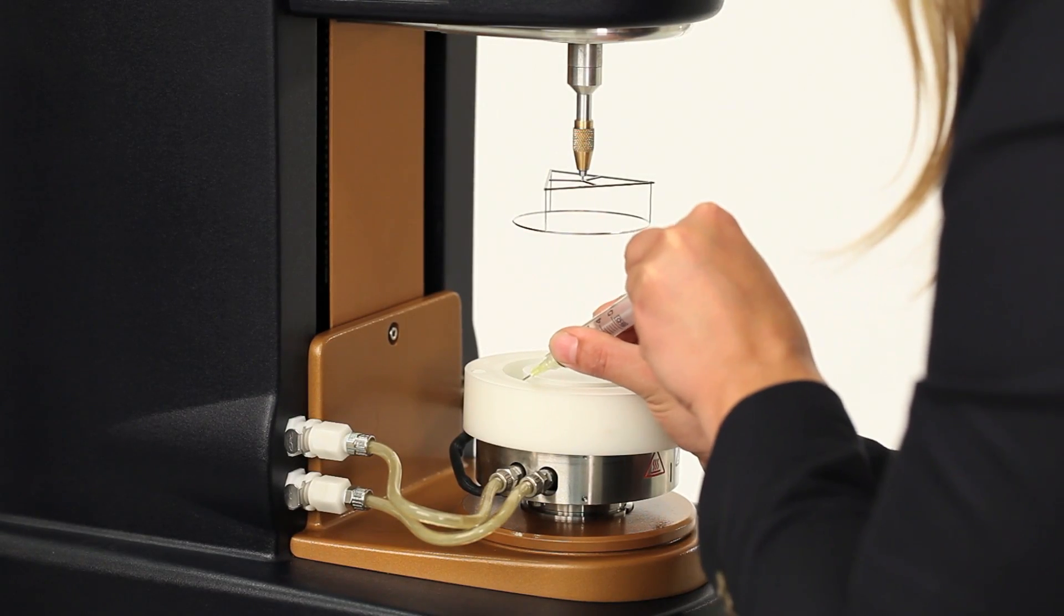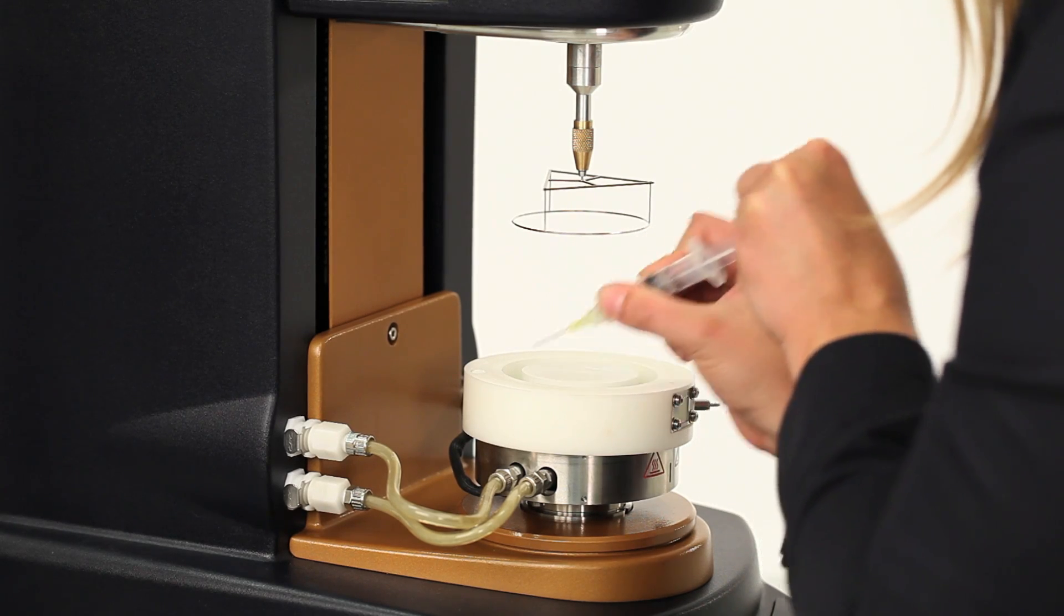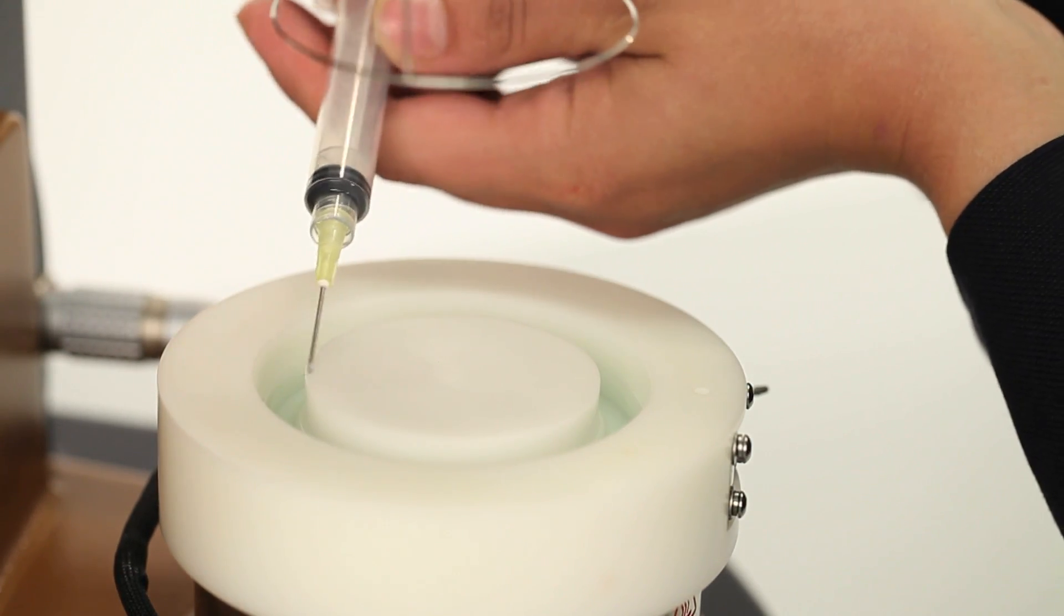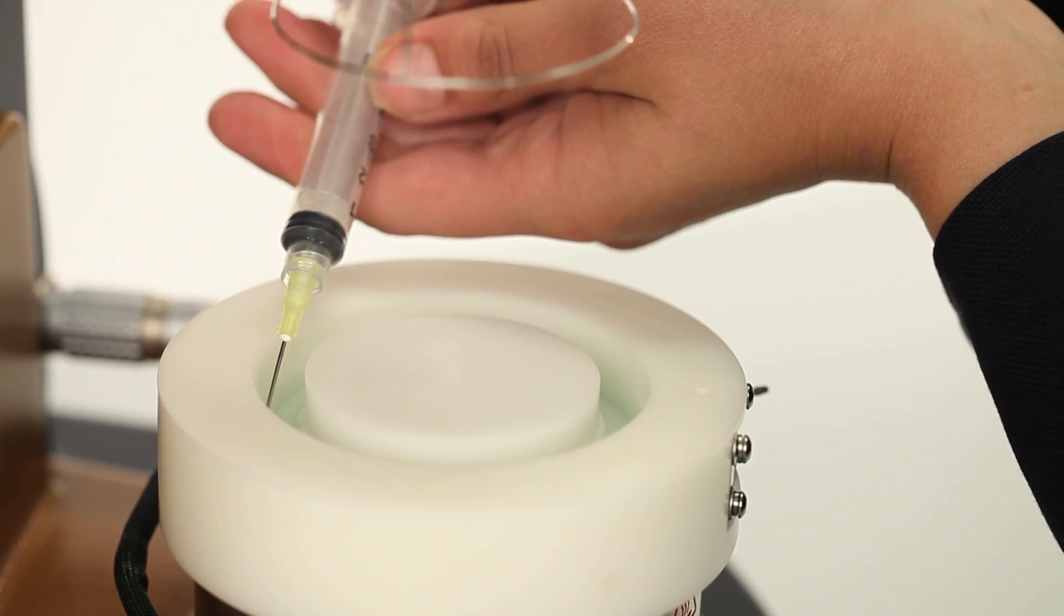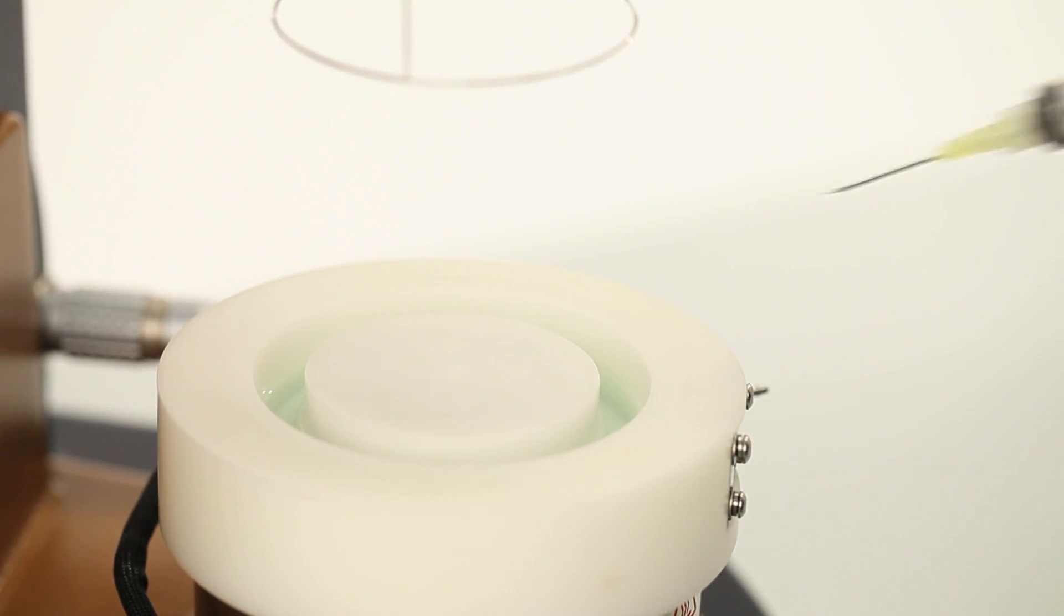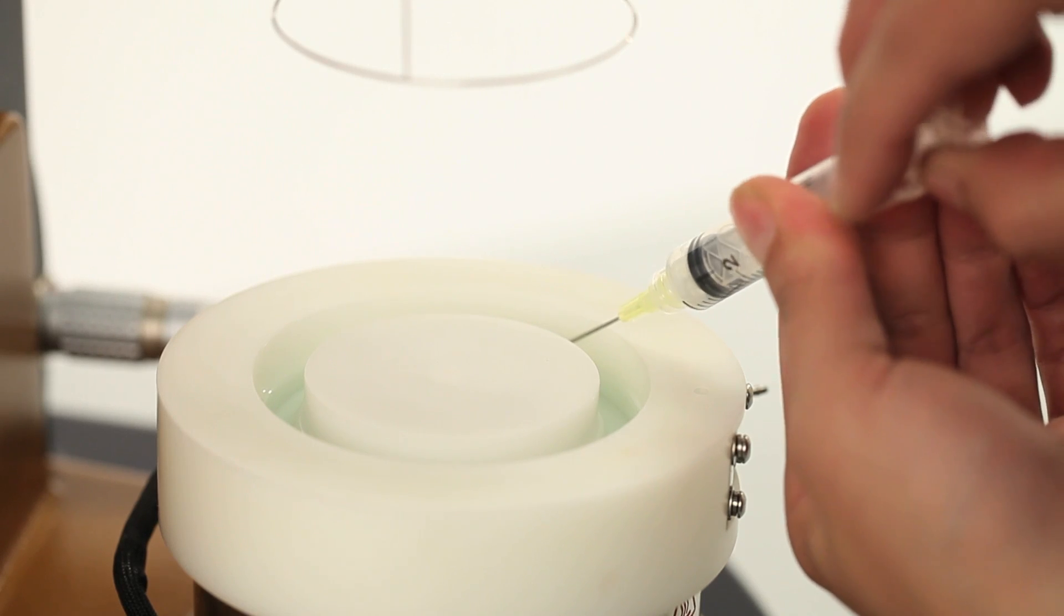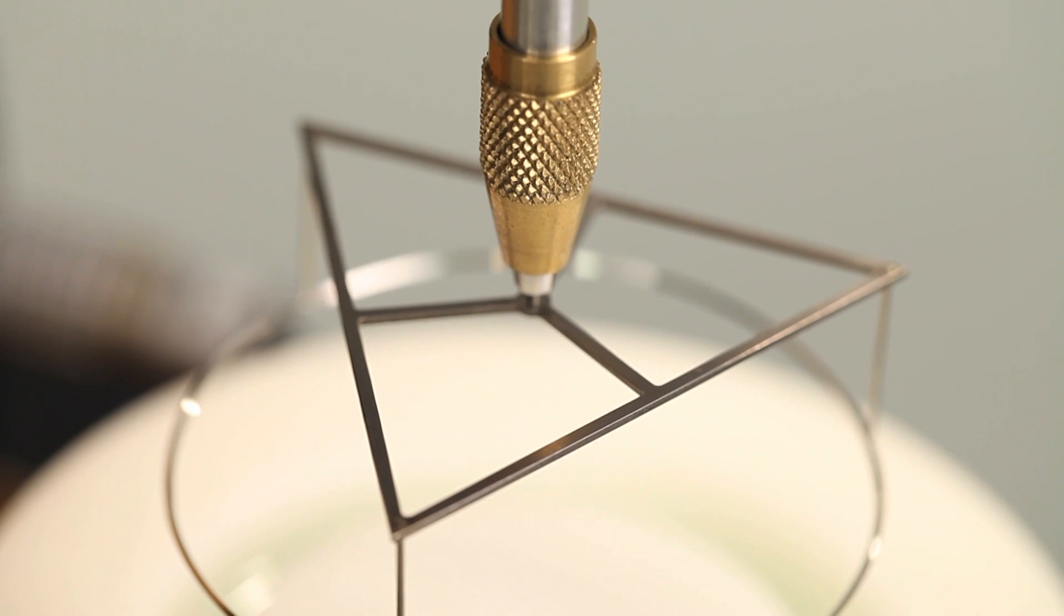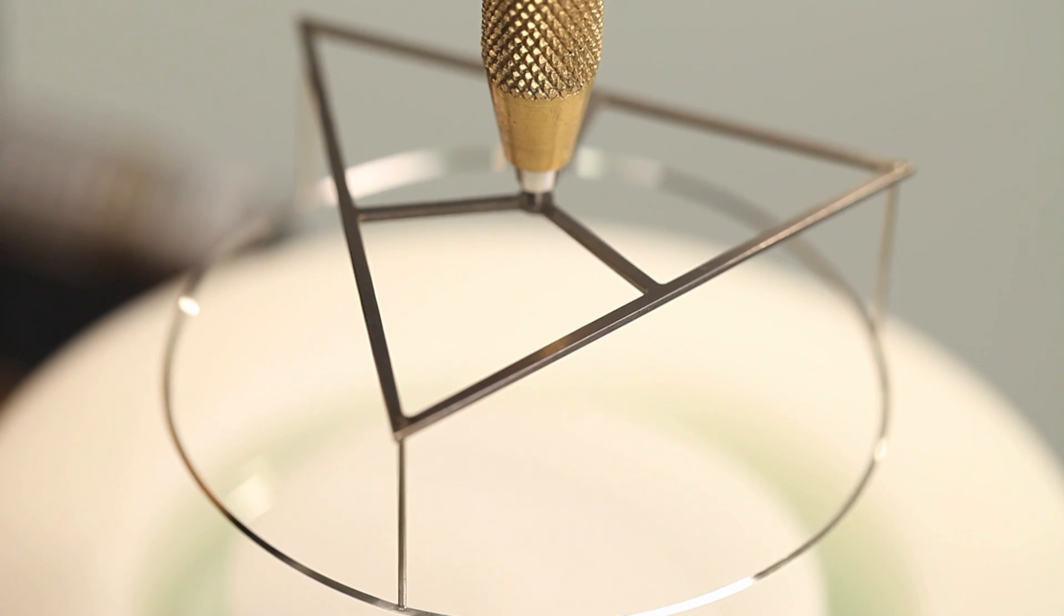Use a syringe or a small glass pipette to draw off any liquid from around the step. Position the tip of the syringe so it is against the step and pull up any liquid. Moving around the edge of the cup, continue to pull off the excess until there is no more sample on the edge. Once the sample is at the same height as the step in the cup and the surface is perfectly flat, we can set the ring at the interface.